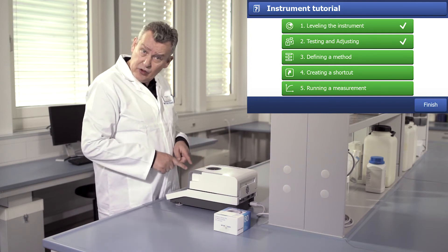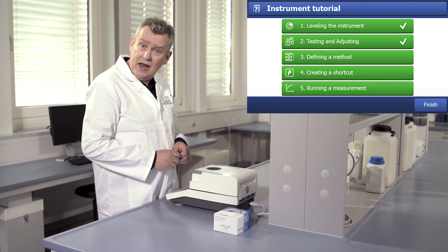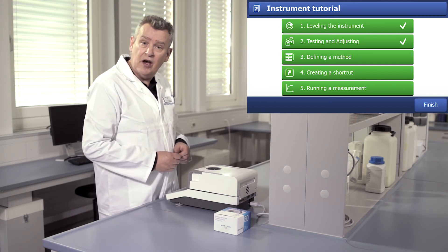This wizard appears automatically when you connect the instrument to the power supply for the first time.